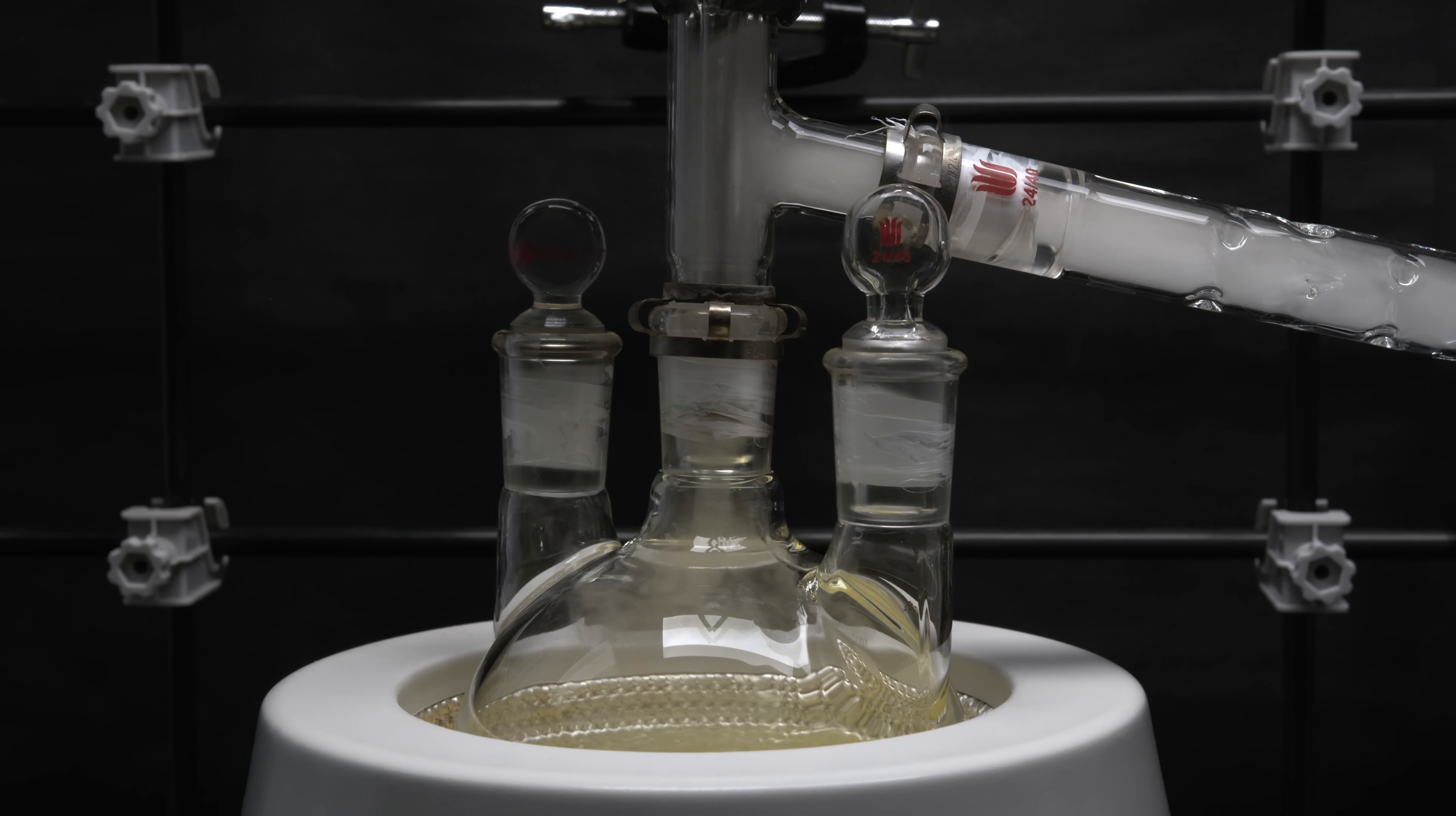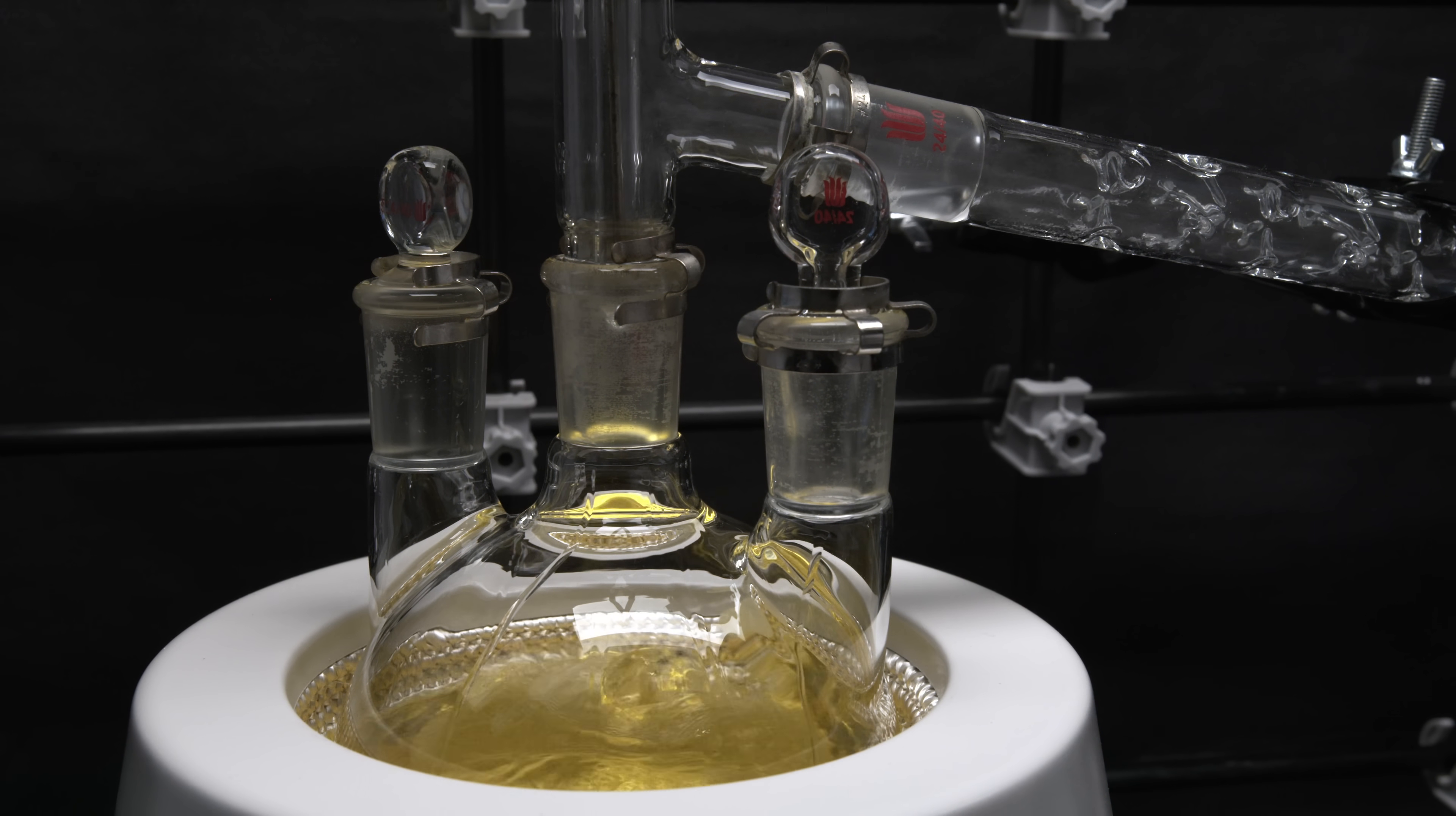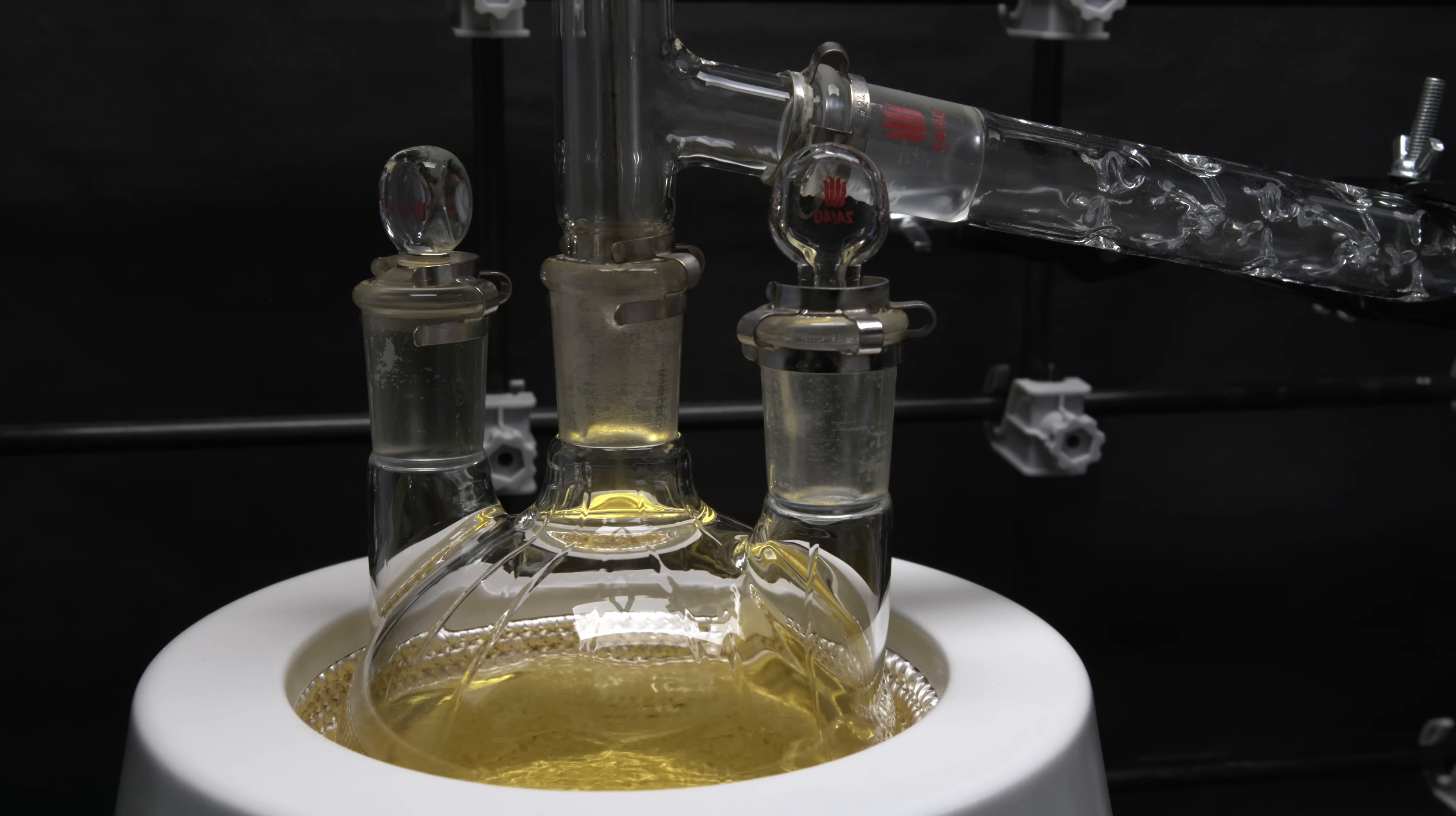So this is definitely a no go. The second one is no boiling chip. Yes, you heard me. No boiling chip actually works better than broken glass. But still, the boiling is a little bit rough, so it is only viable if you do not have any other options. I do not have enough experience to tell whether this is a good method or not, so I need to do more testing at a later time and will update my findings in the comments.